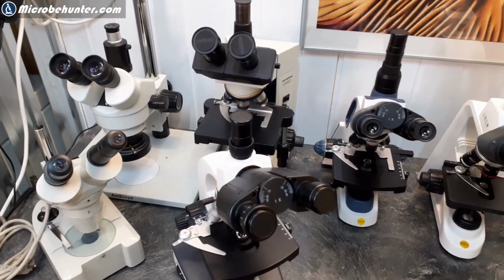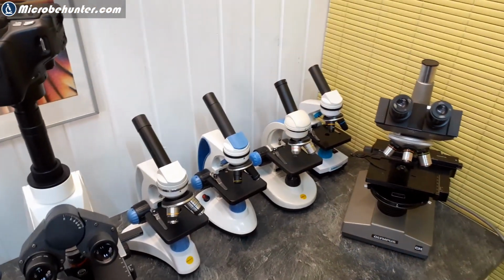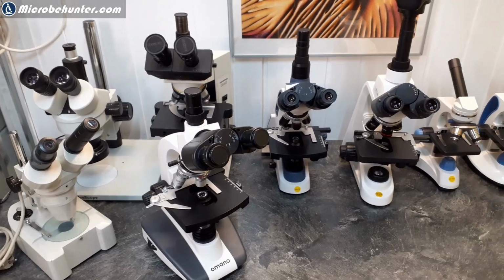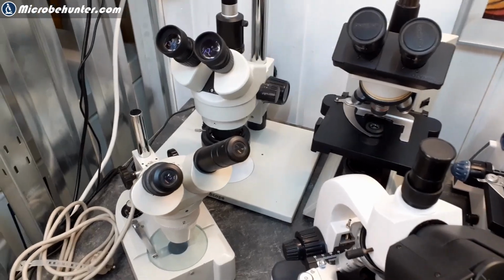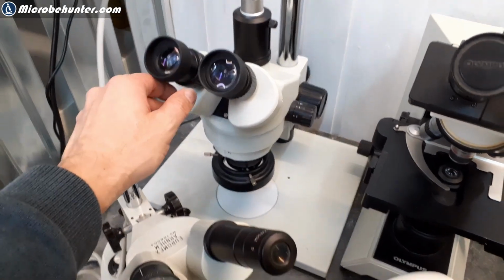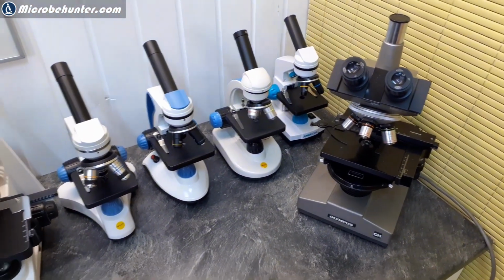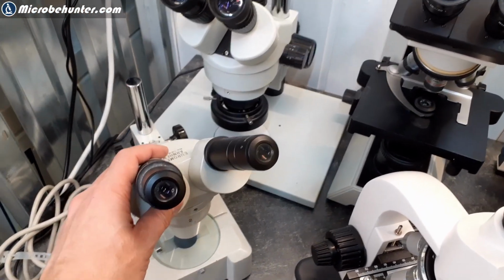There might seem to be a lot of different types of microscopes around, but actually it's not as complicated, because in many cases the differences are not that large. The first thing that you have to consider when making a buying choice is which type of microscope you want to have. Here on the left side, these are so-called stereomicroscopes, okay? And over here, all the way to the corner, all of them are referred to as compound microscopes, and they're fundamentally different. Both are light microscopes, but you can observe different things with them.